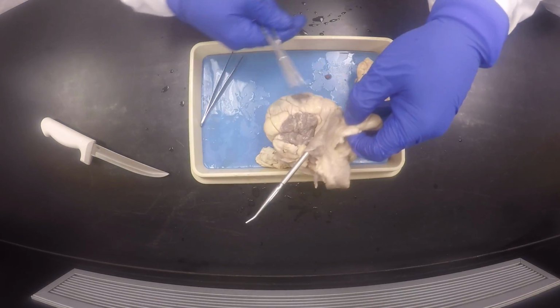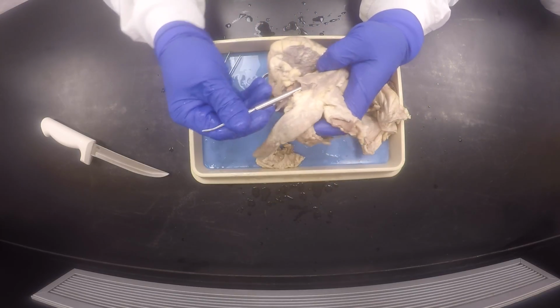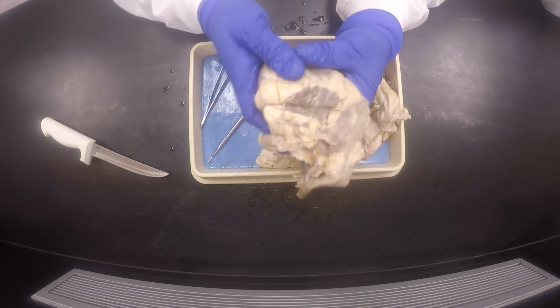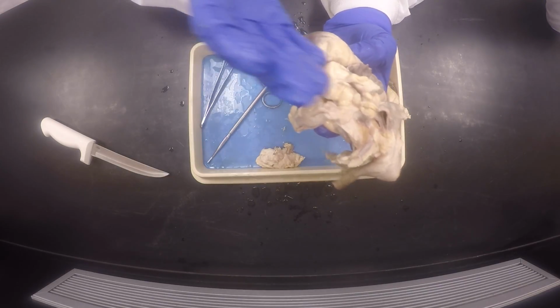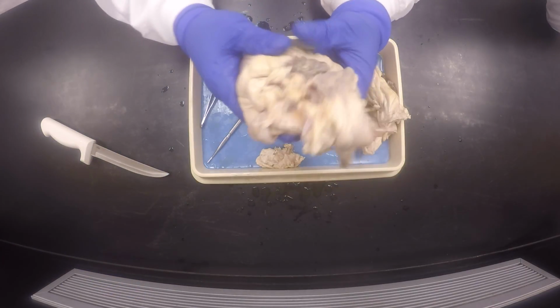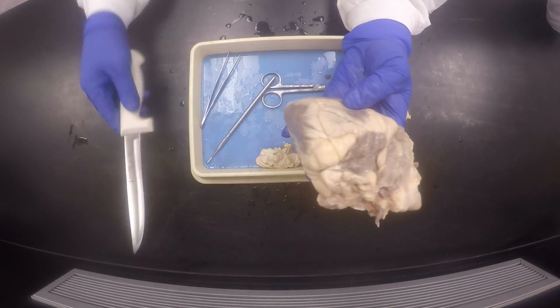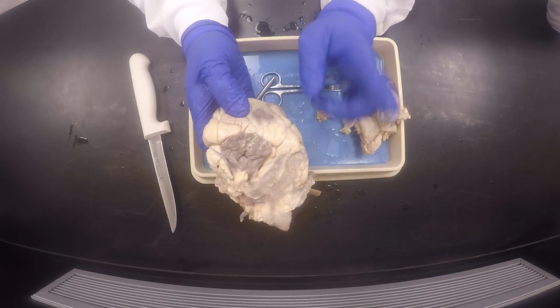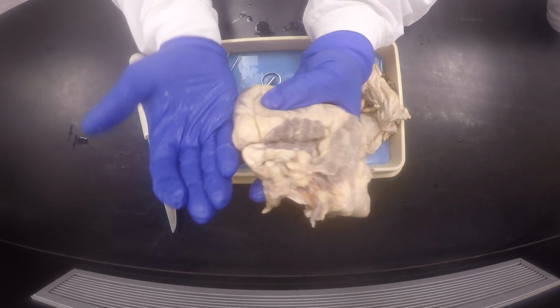So once we have identified all our blood vessels, we cut. That's the first order of business. Make sure you massage your heart, because when you cut in the middle, you want to make sure you're cutting in the middle and not more towards one side. These hearts have been really bashed around, so make sure you do that. You start from the left side, where you see this thing sloping like that, and not from the right. Please don't do that. So you start from this side and then you cut from that.